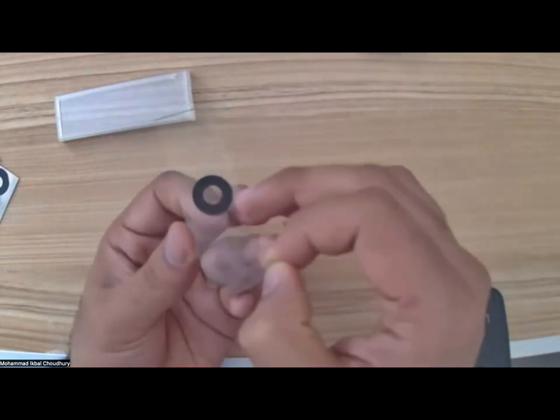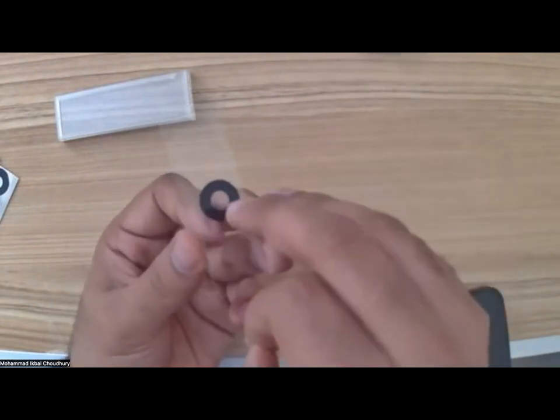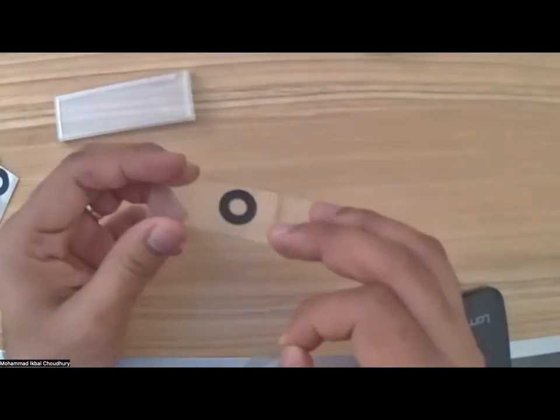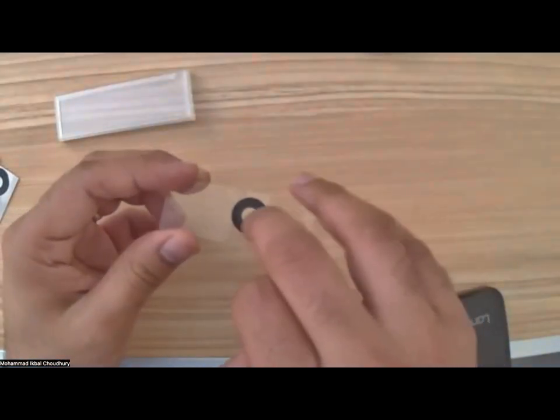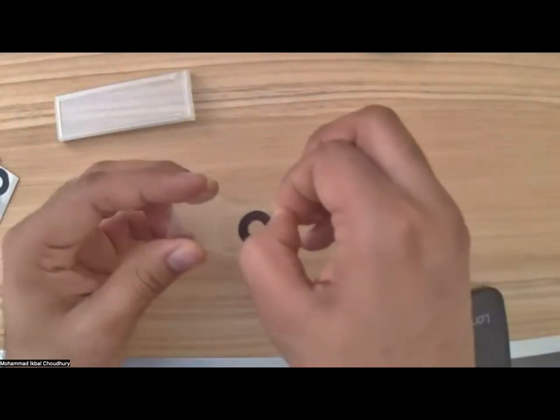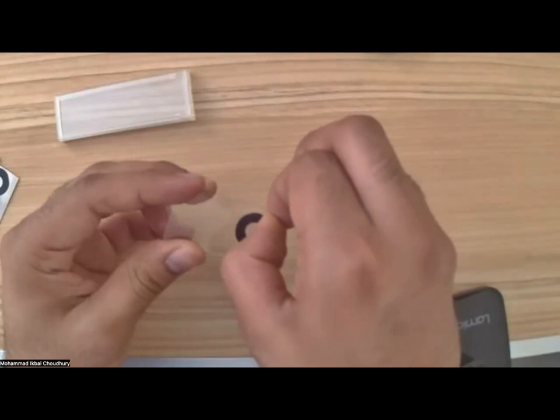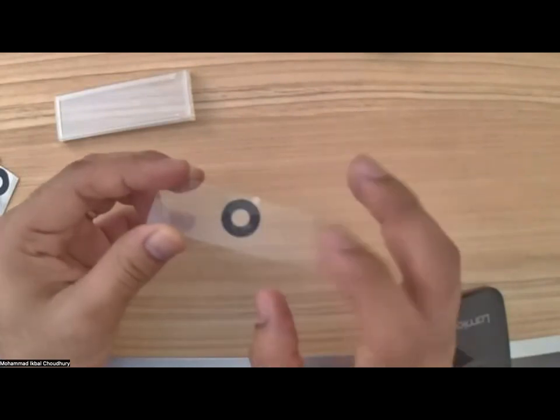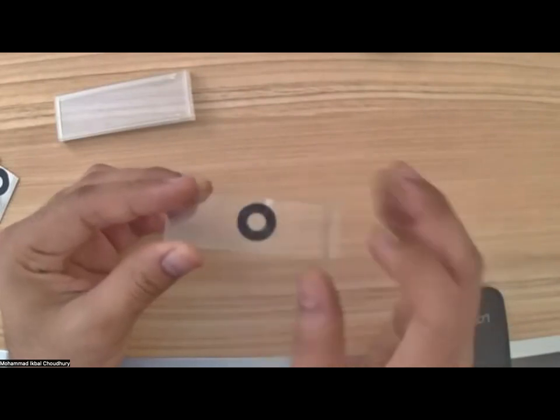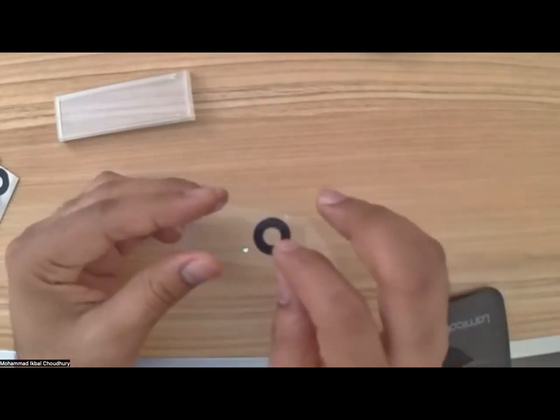Now the ring sticker is exposed. And since it is a donut shaped sticker, it has a tiny compartment where I can place a sample and put the cover back, because everything is so sticky. And if I tap onto the cover, then I have the sample sealed in that sticker.